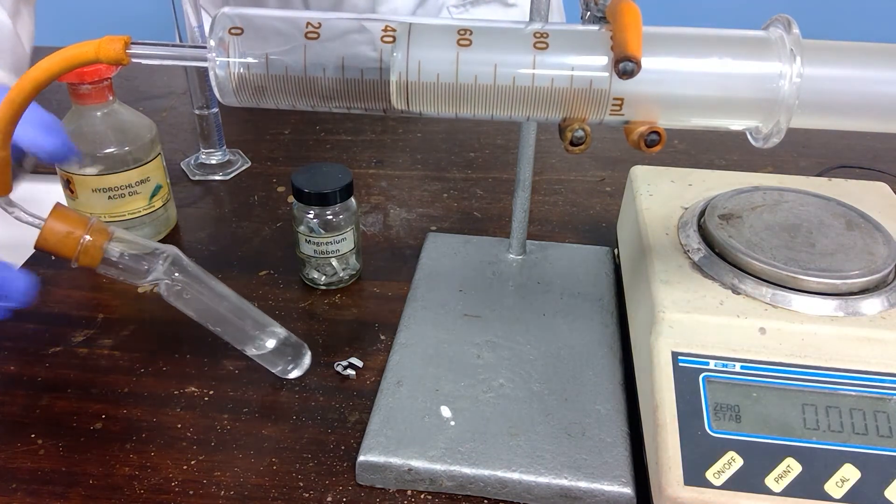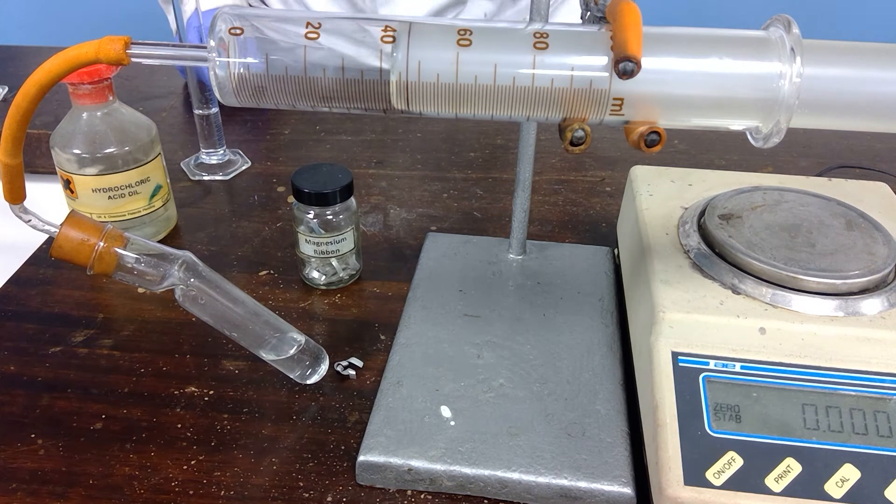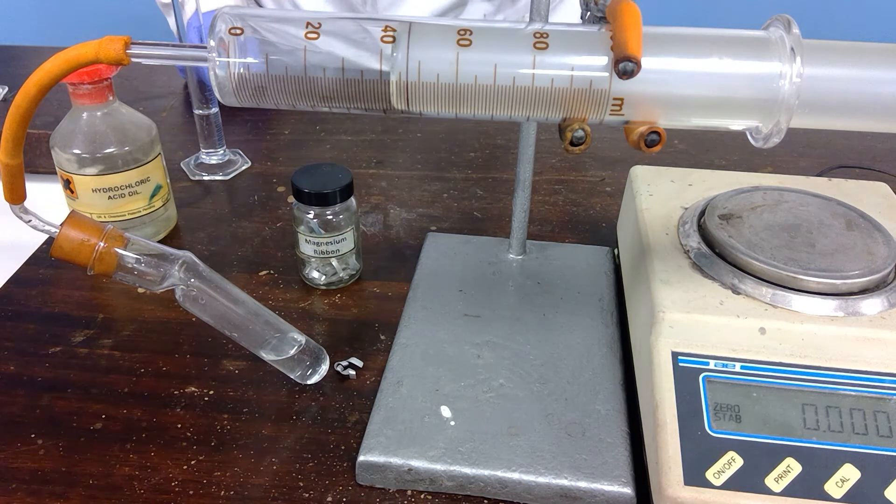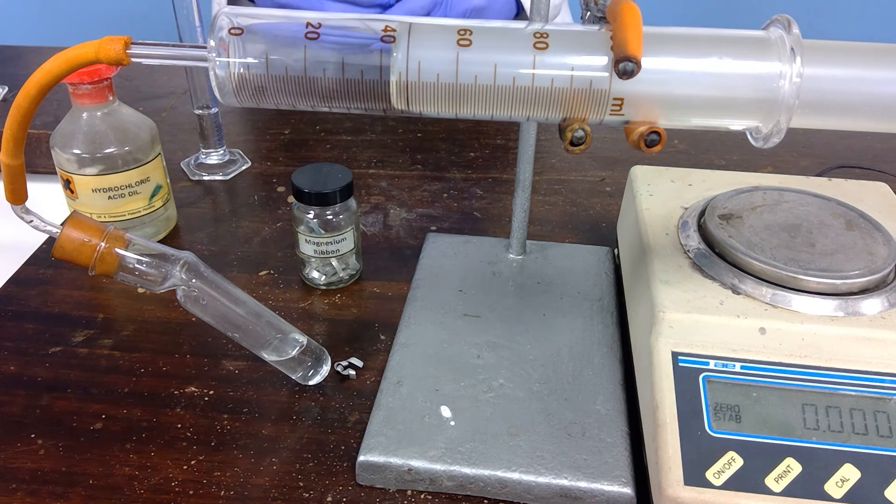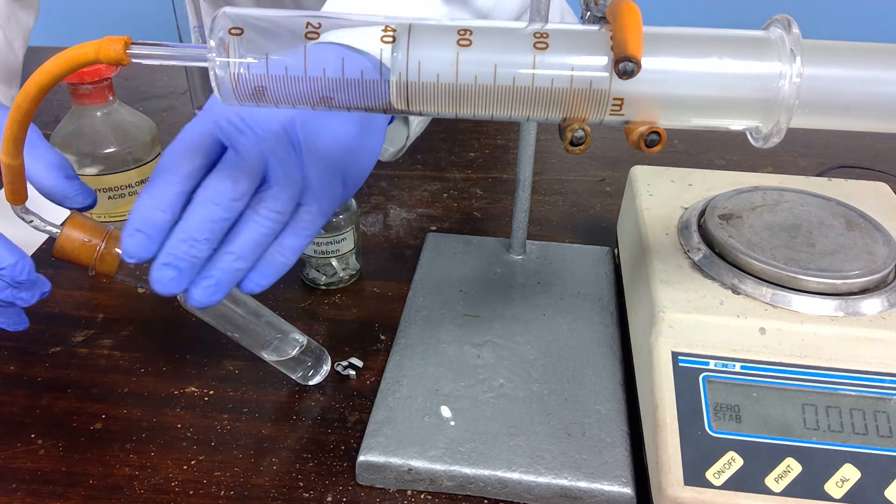And eventually all of the magnesium has reacted and it would seem that there is no more gas being produced. So please read off that second volume reading.